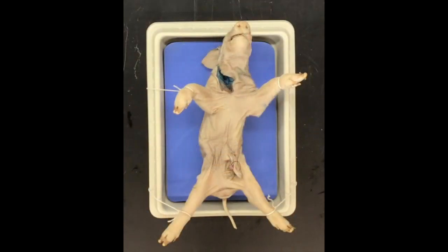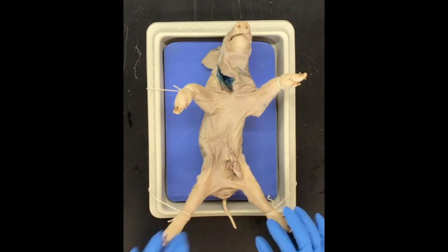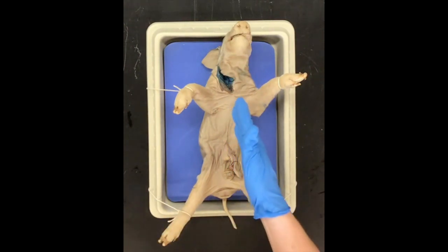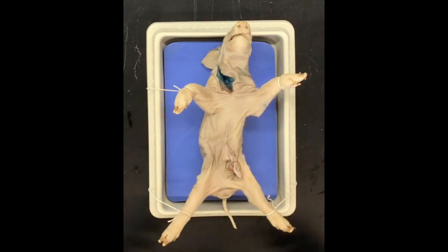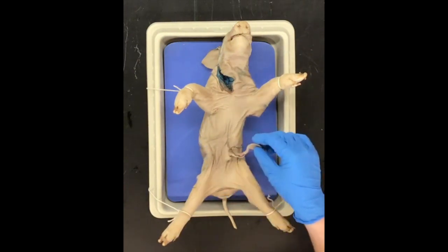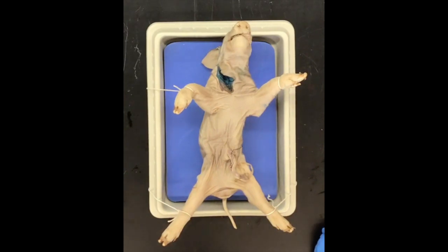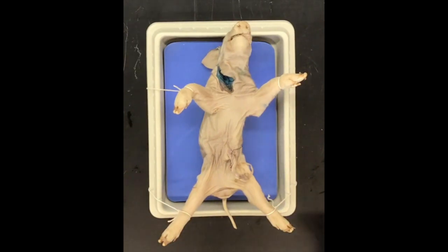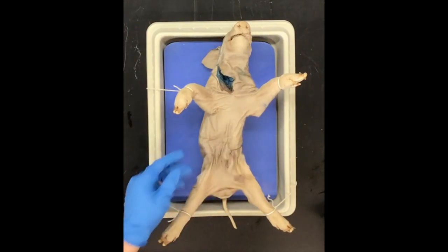All right, guys, so we are back. As you can see, we have tied back the pig so that the legs are spread apart, so we can access the chest cavity as well as the abdominal cavity. You can see here was the umbilical cord attached to the fetal pig. So we are going to go ahead and get started on the dissection. We're basically going to lift up this umbilical cord and use it to our advantage.